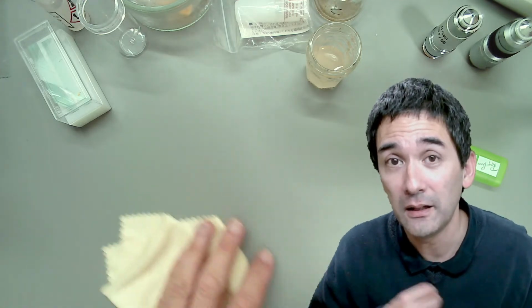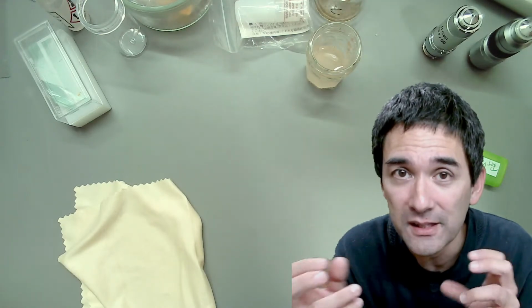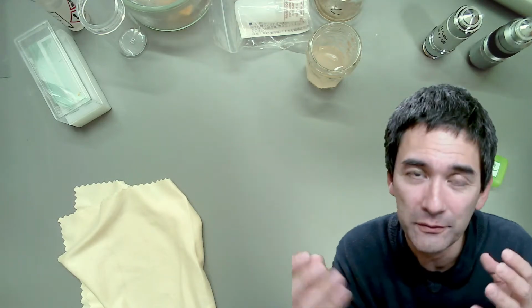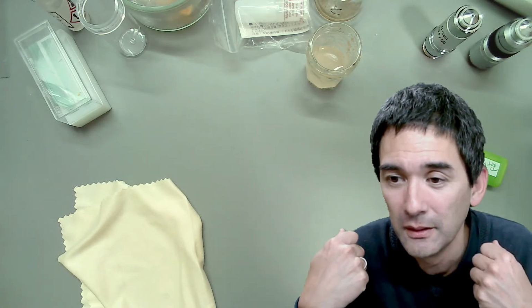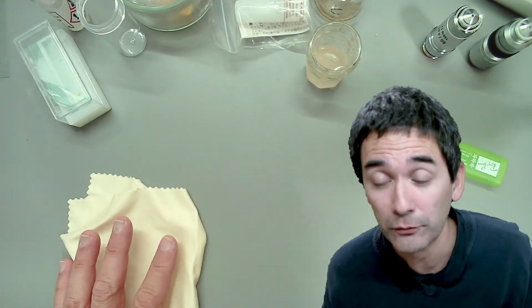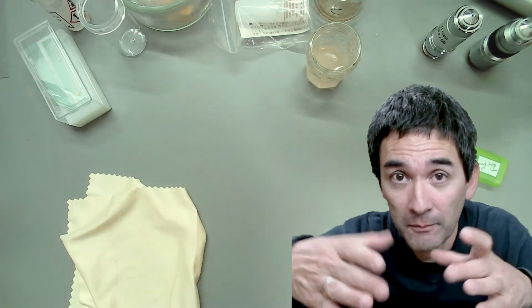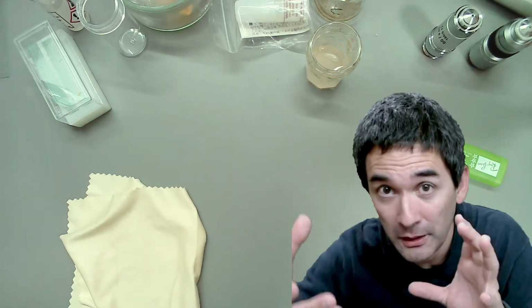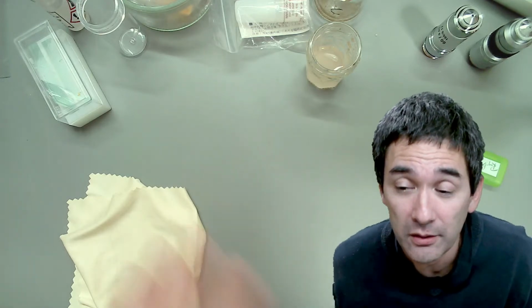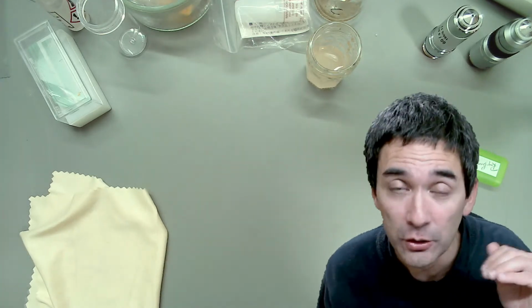And the other thing is that dark field microscopy depends on a refractive difference in the specimen, and if the refractive difference is not high enough, then it's going to simply look transparent. So I would say dark field with oil is probably not possible, but correct me if I'm wrong. There are specific so-called dark field condensers which do not work with a filter, but have a concave mirror system which is able to concentrate more light, and maybe it might work there. But with the homemade solution, I'm already at the limit. I'm stretching it already with a 40 times.